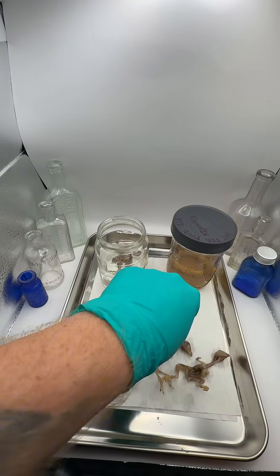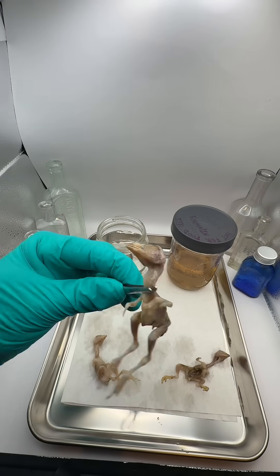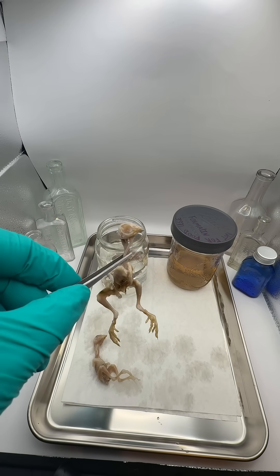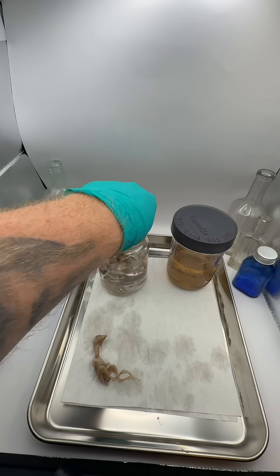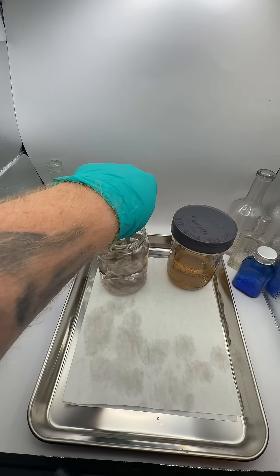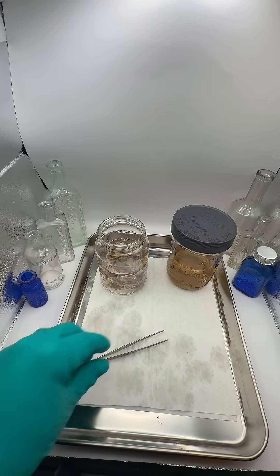The purpose of doing the water bath is to remove excess preservatives from the specimens — you want to get as much formalin out as you can. The water bath is also rehydrating the tissues, as it would be pretty difficult to stain or dye the cartilage if you were unable to penetrate dry muscles and tissues.